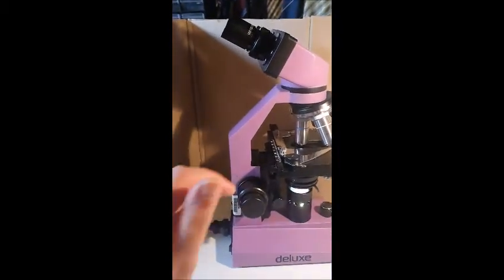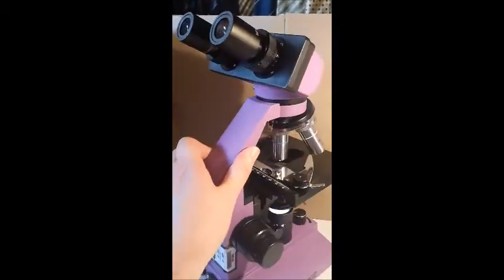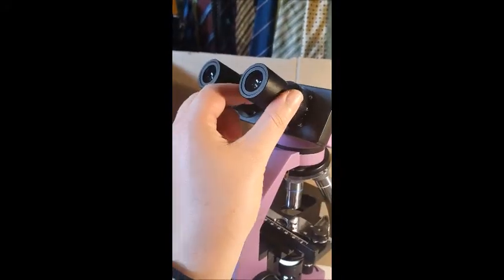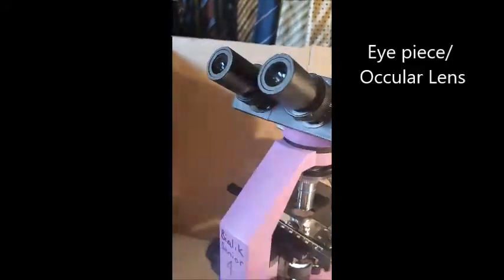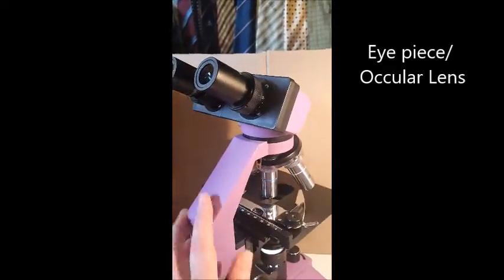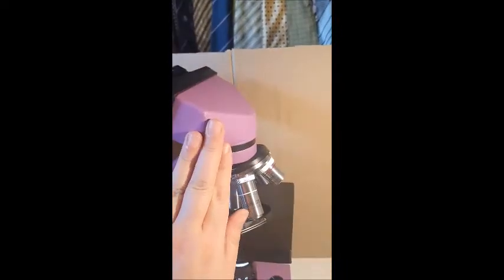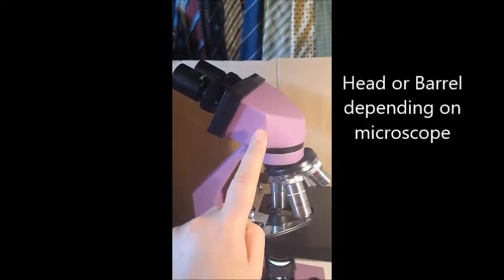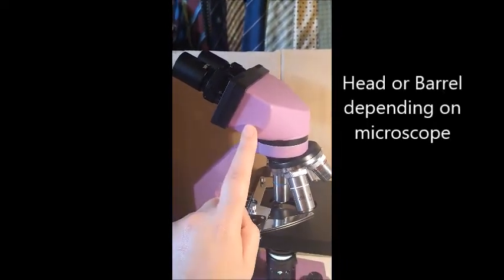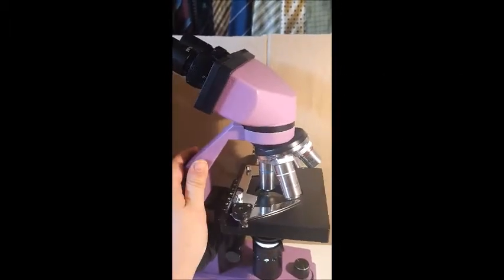So we'll start at the top. We have these eyepieces, or ocular lenses, ocular meaning eye. So you look through those, and then coming down, we have this bit, which is called the head, or in monocular microscopes, it's just like a long tube, so it's called a barrel.